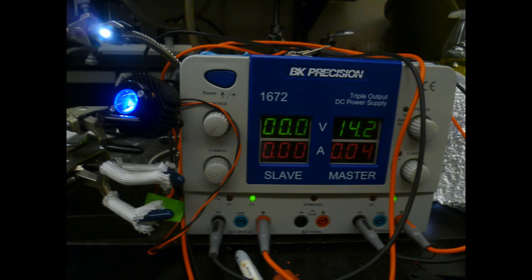To irradiate our photocatalyst during measurements, we typically use a 300-watt xenon lamp focused by a fiber optic cable, seen here in the upper left-hand corner, or for visible light only, we use a 435 nanometer LED powered by an external power supply.